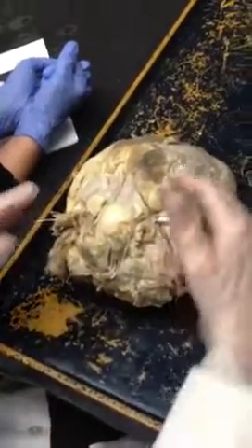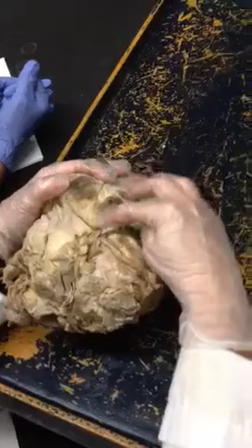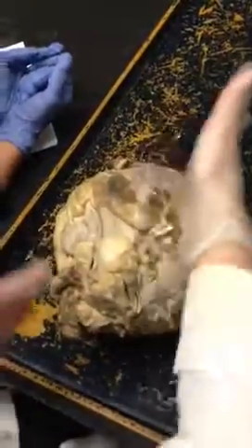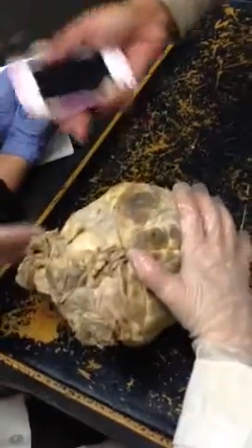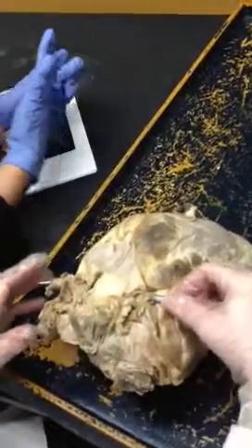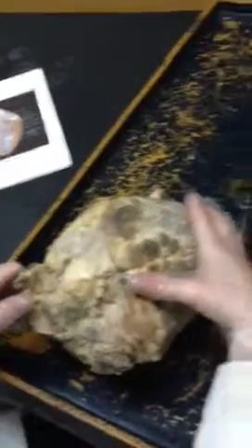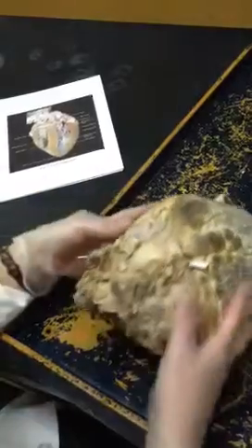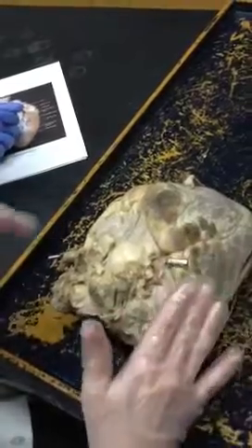There would be some kind of stick or rod stuck through to help you notice they go together. The portion that's closer down here is going to be the inferior vena cava, and the one that's up here is going to be the superior vena cava. It doesn't quite go straight up and down, but whichever one is higher — think of the top of the heart. So superior vena cava is up, inferior vena cava is down.